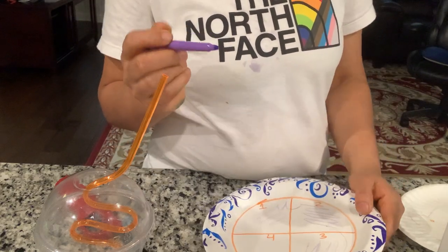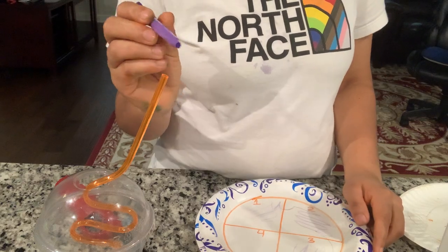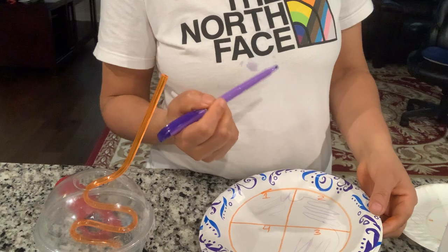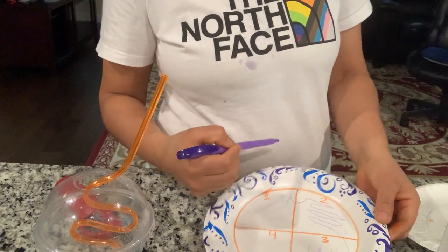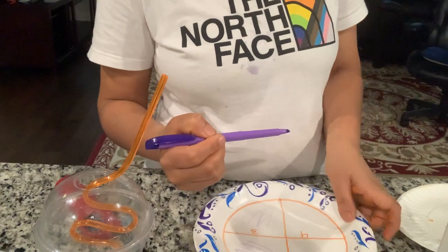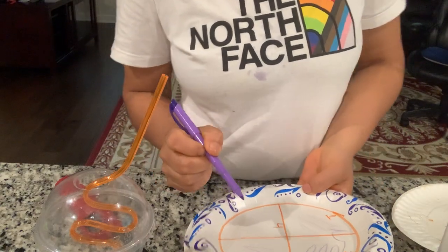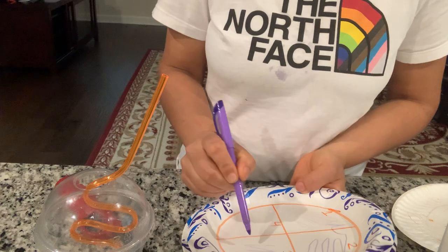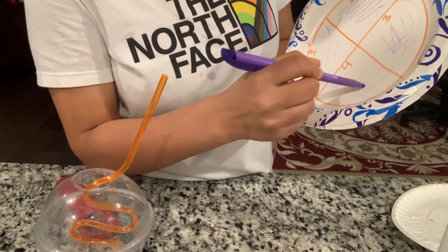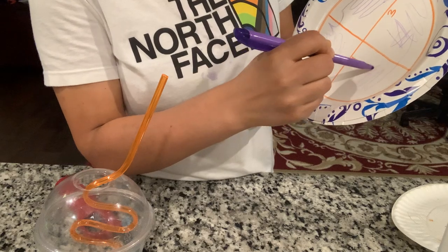Again I'm going to put the loop on the flame and let it cool down. I'm going to draw quadrant four — for that I need to bring some sample from quadrant three, like this. And I am drawing quadrant four.